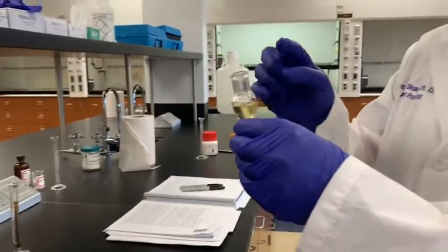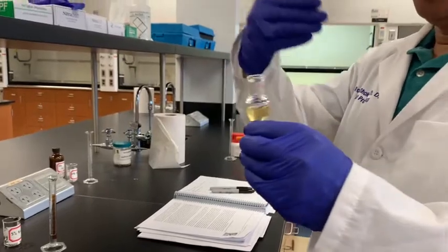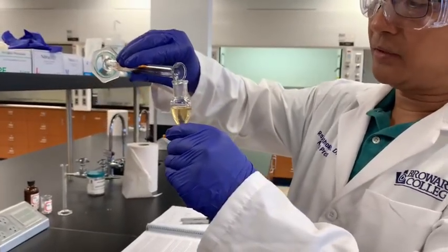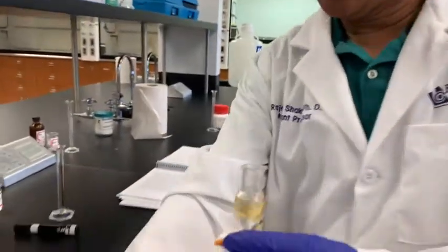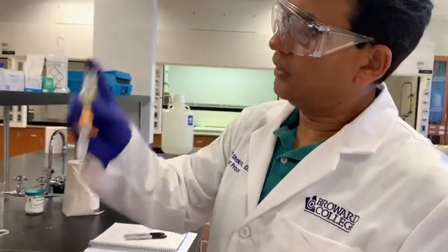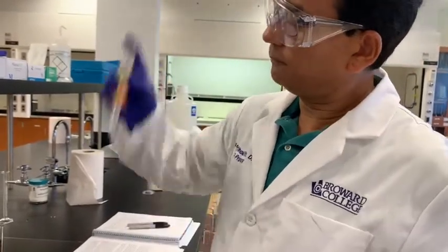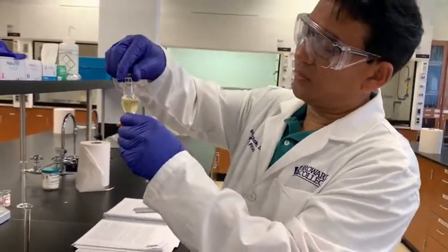Now I need to add 2 more milliliter of sodium hydroxide in order to clean the product here. So this is sodium hydroxide again, 2 milliliter. This is what I will add in this mixture there. So you see some fume is coming here. And we need to do some shaking here. So this is the cap that fits perfectly. So I will just quickly shake, and then I will allow the vapor to go out for a second here. Do one more time. This go away.